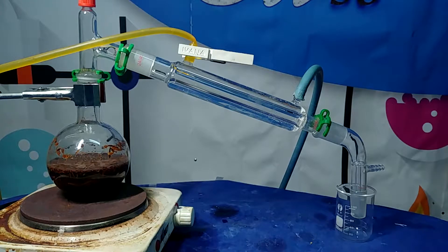That's why we can observe a cloudy color from our solution that we obtain from the distillation because the oil is diffused over the solution and it causes the grey color of our solution.